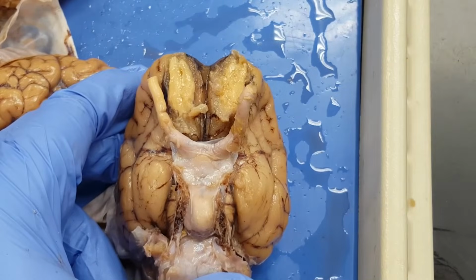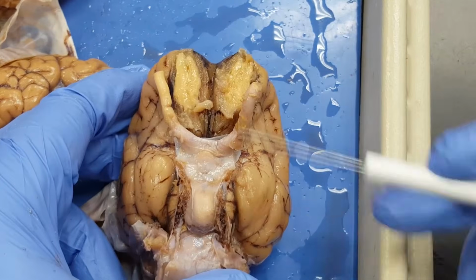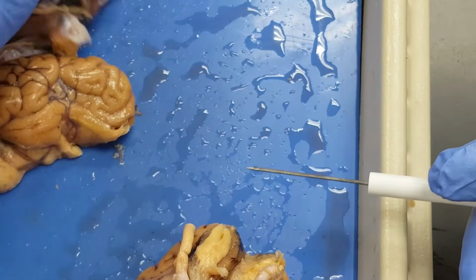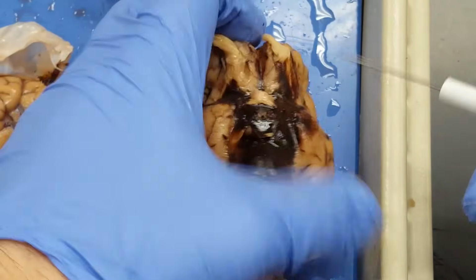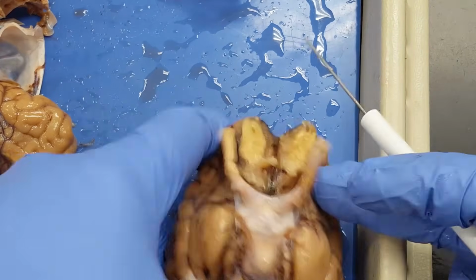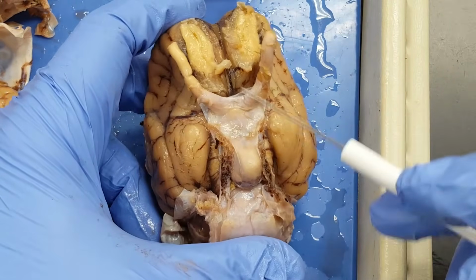Okay, everyone, I had to give up on that first brain I was working on to see the underside because there was a major hemorrhage here where the pituitary gland is. How could I tell? I don't know. Something gave it away. Look at that. Yeah, I'm the sheep medical examiner here. So I just randomly selected another brain and dissected it out, took off its dura mater.